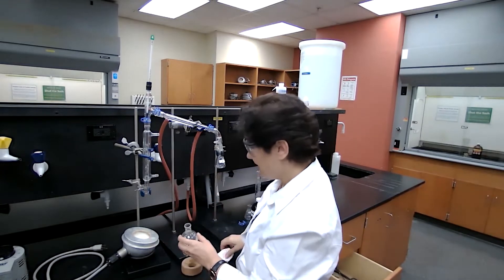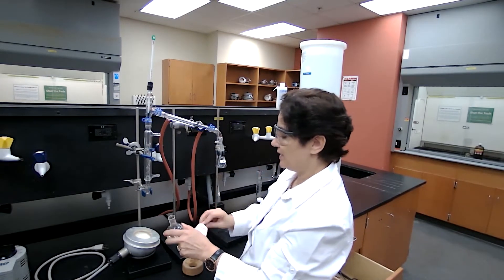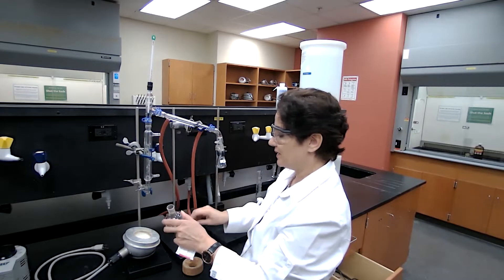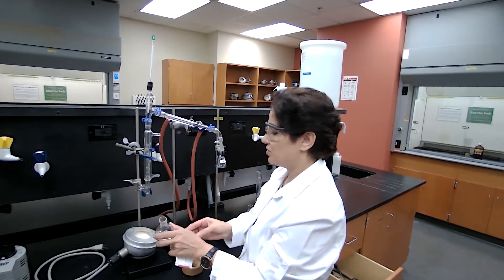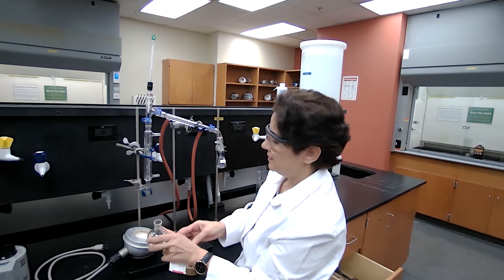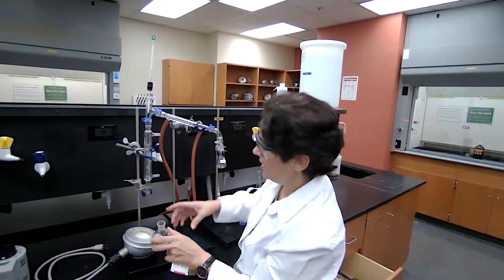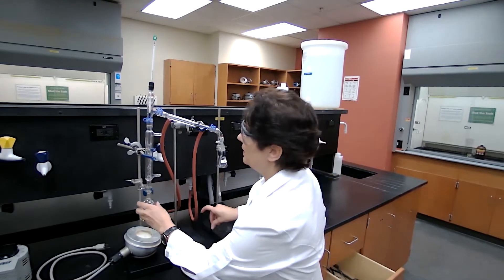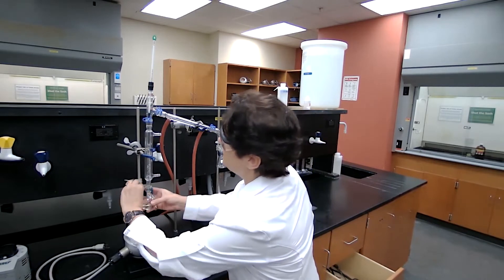Make sure this is greased, which is greased. Already I greased it when I was doing the assembly. I want to just make sure that it's sealed and greased properly. Add some more. Connect, secure.